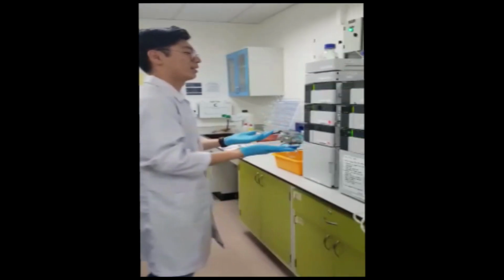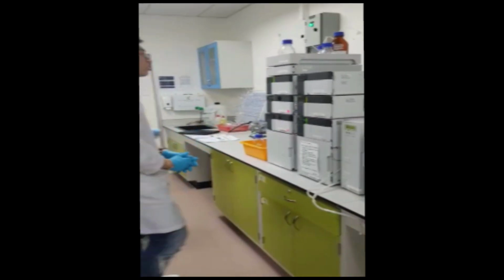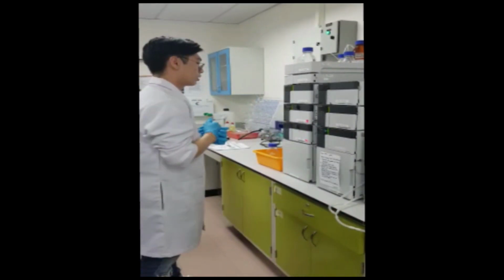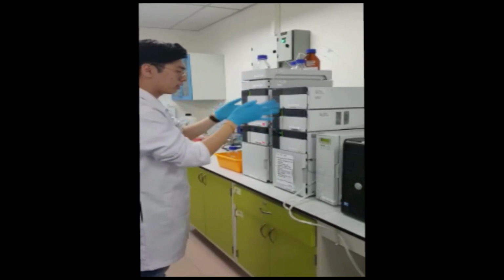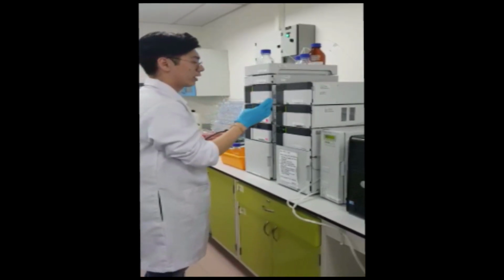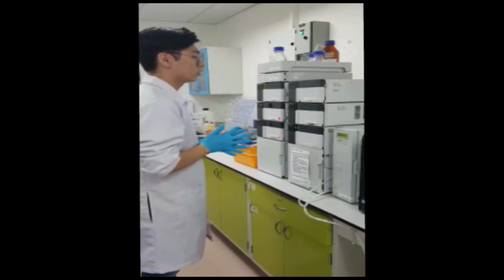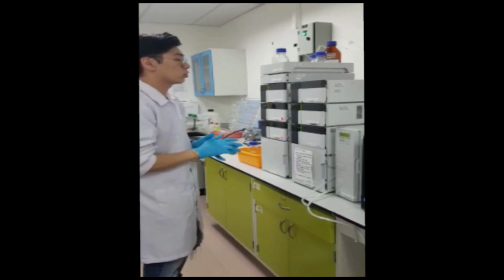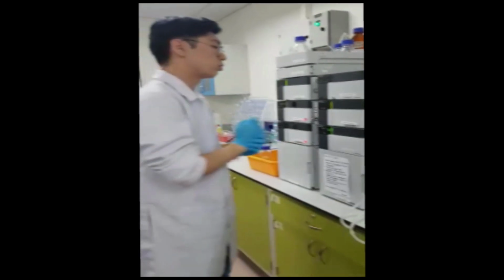Good luck! We are already in the HPLC system. Wow, such an expensive system. So here is the mobile phase reservoir, you can see we have the communication bus module, and I think this is the detector. We have the photodiode array and refractive index 2-in-1, but I think today we are going to use the PDA as we are going to determine caffeine, and the photodiode array detector can measure simultaneous wavelengths in one go. That's why we use this.